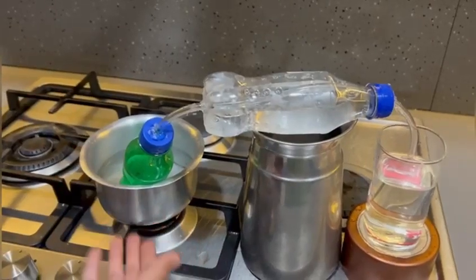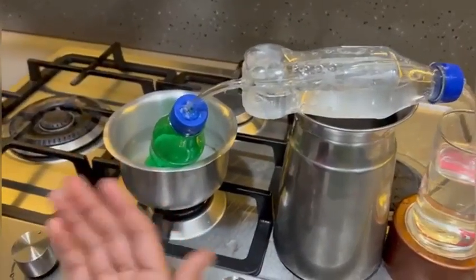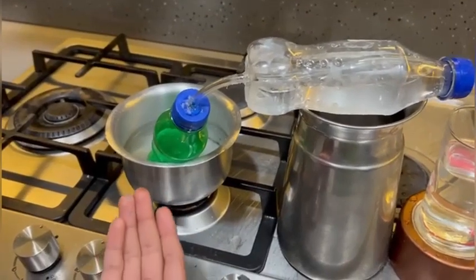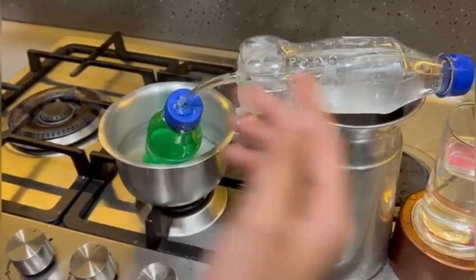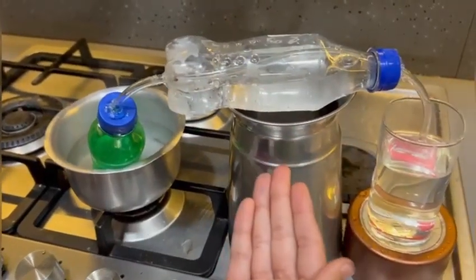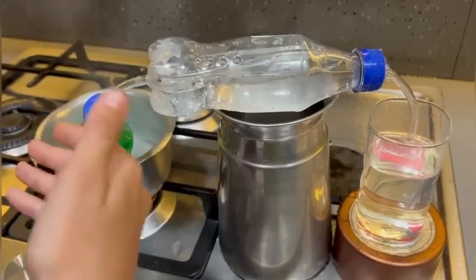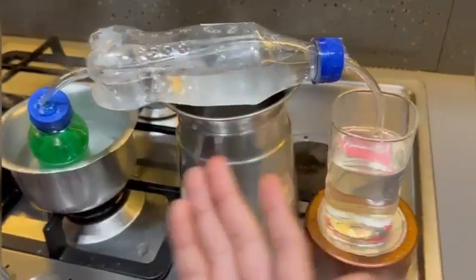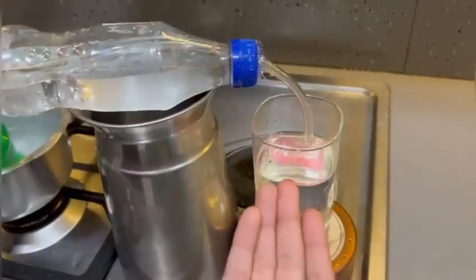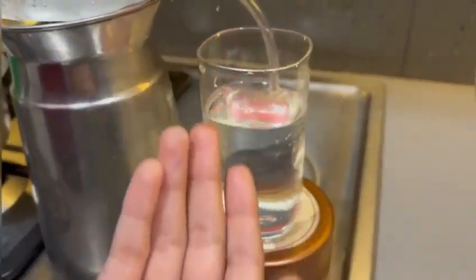The water in this vessel is heating up, which results in the evaporation of alcohol. In this bottle, ice cold water is filled. It makes the vapor into water. And here we have alcohol.